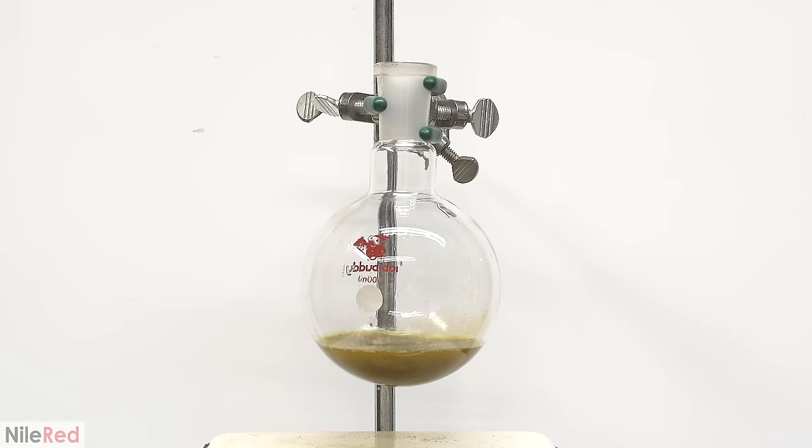A couple days later, I take my piperine out of the fridge and it's time to filter it off. I quickly do a vacuum filtration and I leave the vacuum on for a few minutes to dry things up. Using a spatula, I scrape the piperine off the filter and I'm left with this paste. One thing to note is that some of the piperine is super fine and it's not able to be trapped by the filter. It might look like a lot, but there actually isn't very much here.